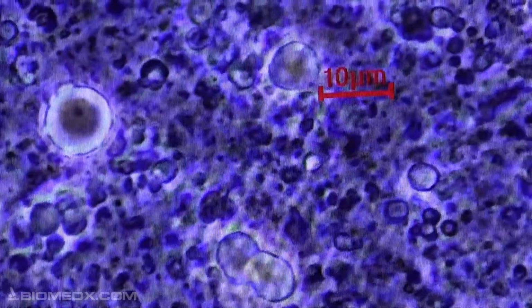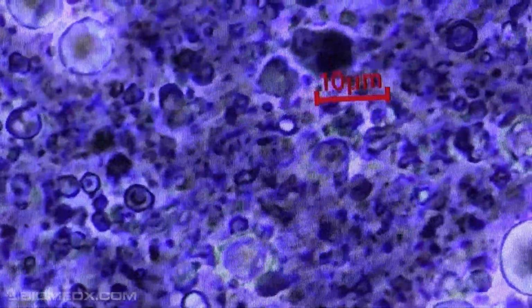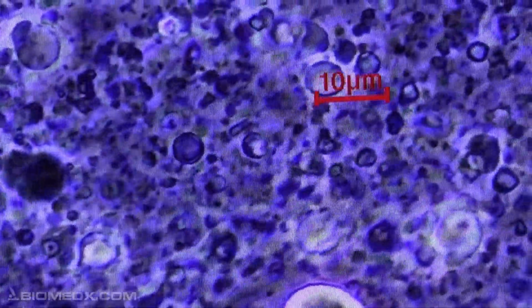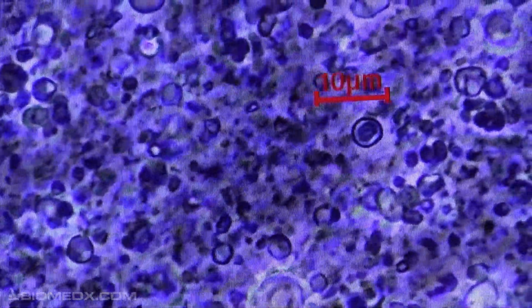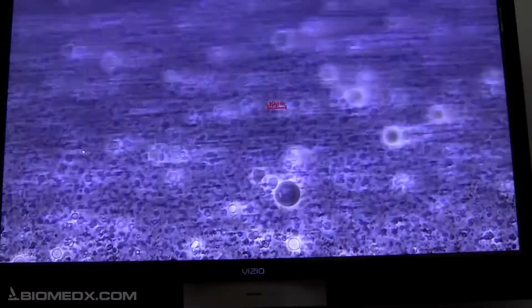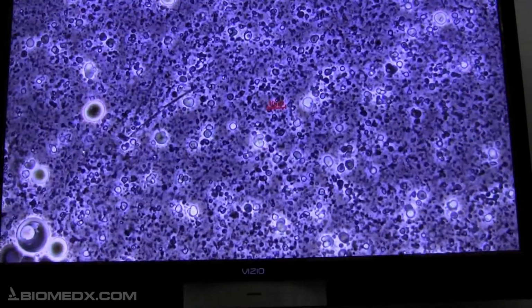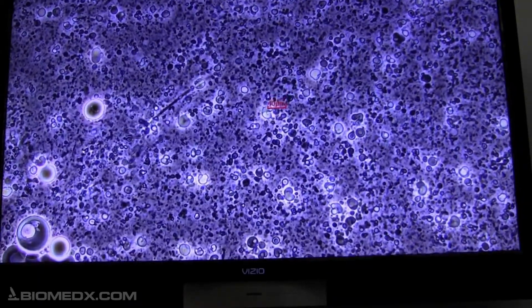Now those, I would say, are liposomes. They're round beads, various sizes. You've got some pretty large ones, almost 10 micron, even larger than that, to little small ones. If we were to look at the little teeny ones that are passing, maybe 500 nanometers. Now, if I took the slide and if I smooshed it down a little bit and got more of the liquid out, we can get a scene where those liposomes would just sort of be stopped. In fact, I'm going to pull the slide off and I'm going to squish it. So I pretty well smooshed it. Liposomes are still intact.